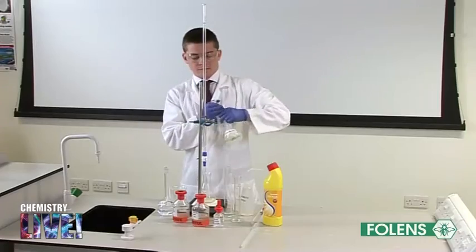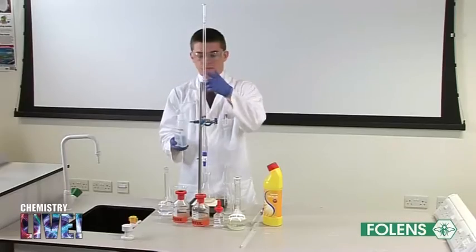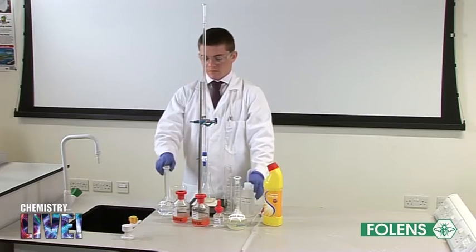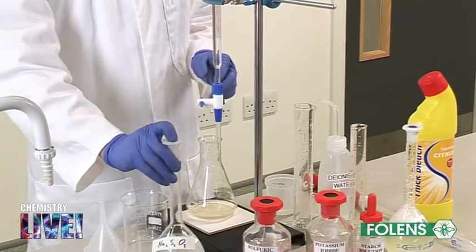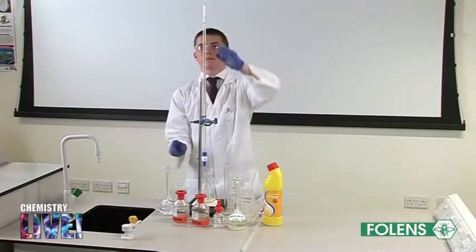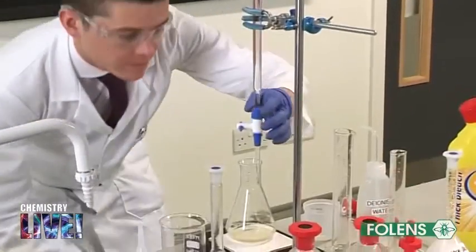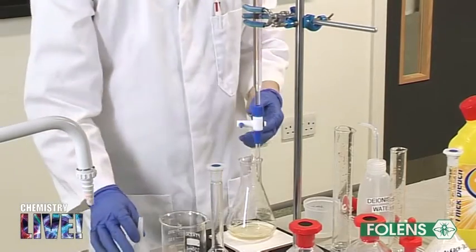The burette, pipette and conical flask have already been washed out with deionized water. The burette has been washed out with some of the 0.1 molar sodium thiosulphate solution previously standardized and filled up to the mark with the solution. We have checked that the tap and space below the tap are also filled and the funnel has been removed from the burette.